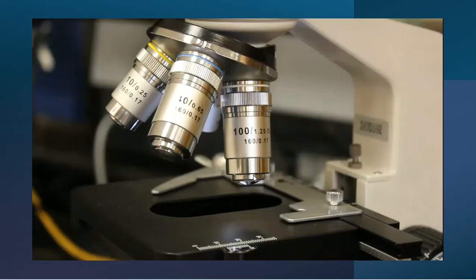I just felt that raising that platform all the way up to the top, always starting with the lowest magnification first, and then trying to find that sample in that zoomed-out lens perspective, always kept me in the ballpark of where I need it to be. And then I would increase the magnification as needed, and adjust the platform as needed once I pinpoint that very first one.